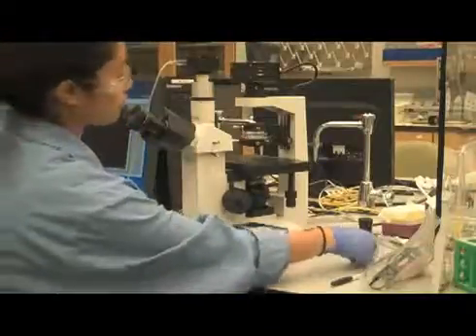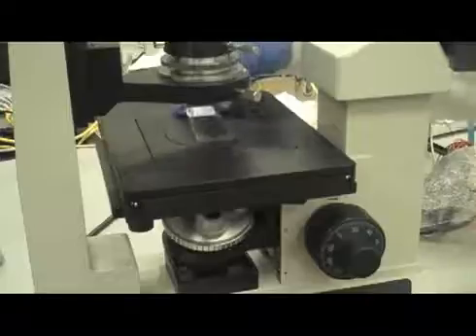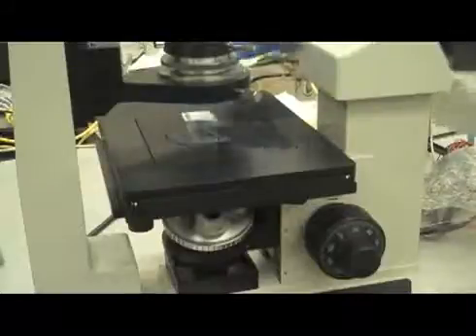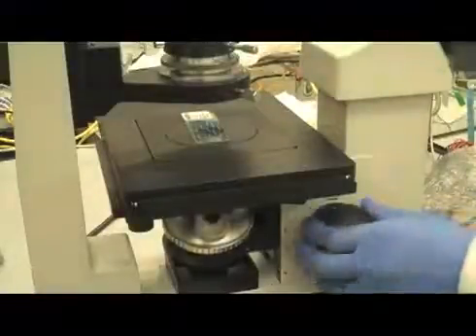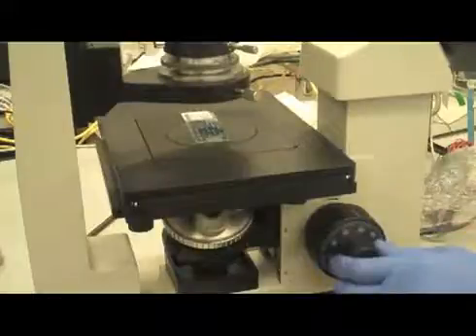Step 9: Place the specimen at the center of the stage and focus the specimen using the coarse focusing knob and the fine focusing knob to observe the image in bright field.